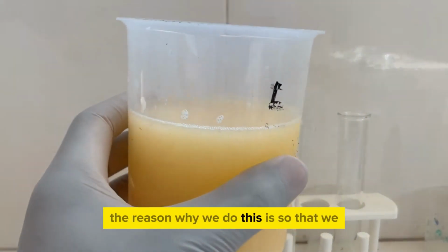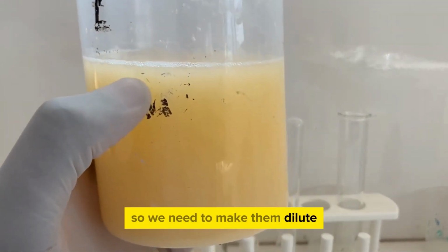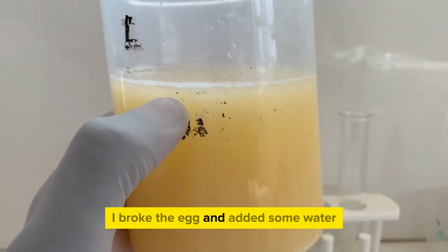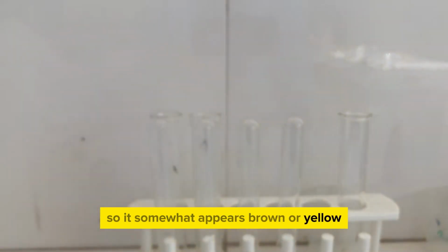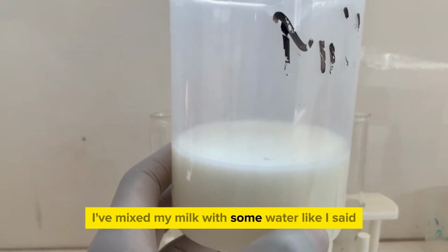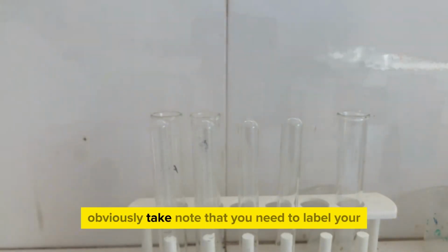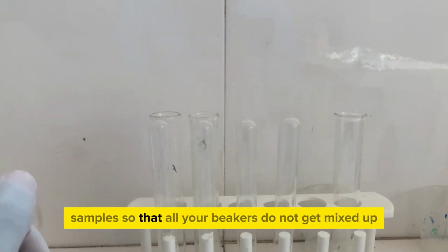The reason why we do this is so that we dilute them, because they are too concentrated, so we need to make them dilute. Here's my egg solution. I broke the egg and added some water, so it somewhat appears brown or yellow. And this is my milk solution. I've mixed my milk with some water, like I said, so that I can have the milk solution. Obviously, take note that you need to label your samples so that all your beakers do not get mixed up.